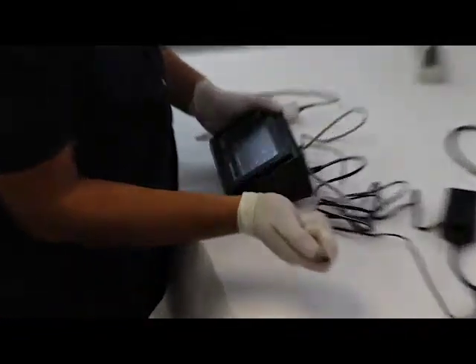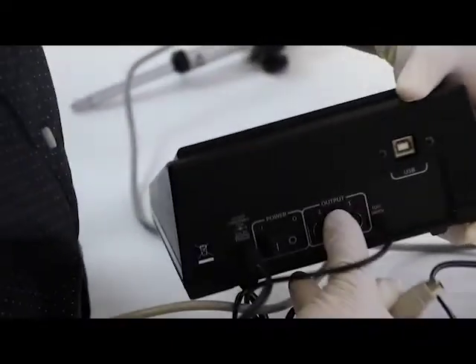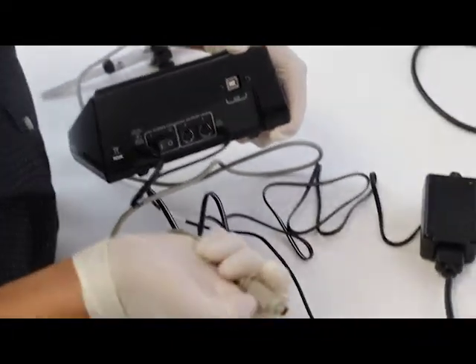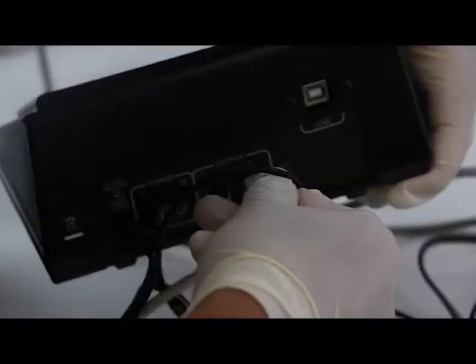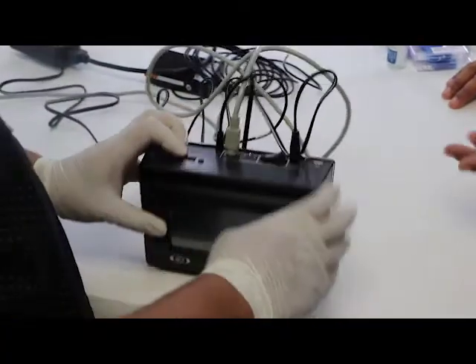The Micro 2T is a two channel injector so you make sure that you plug it in to the correct channel that you're going to use. The connector for the Micro 2T has an indicator like an arrow showing you how to plug it in. Just make sure it goes in straight and it's in. Right now we're going to turn on the unit.